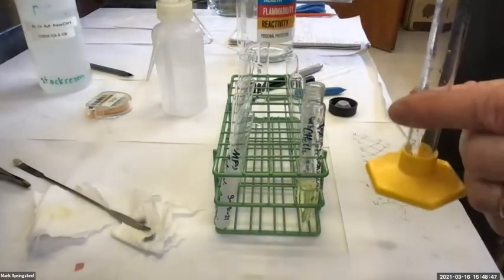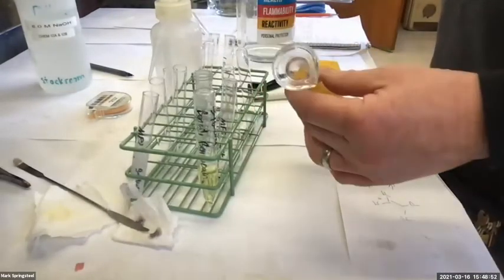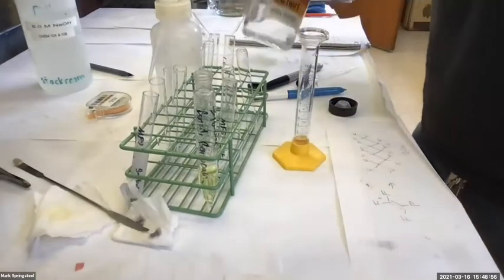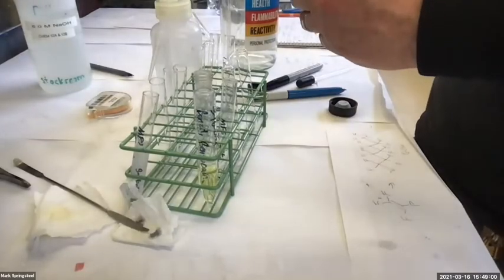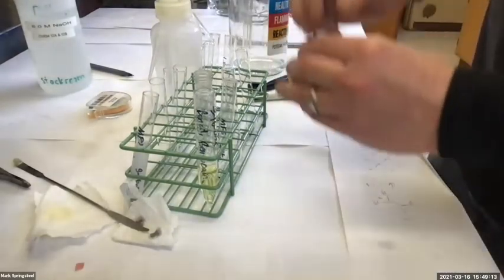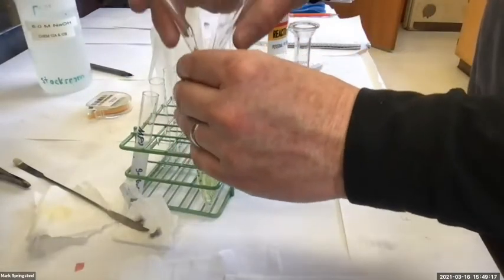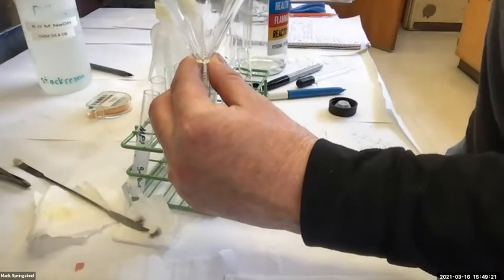This had a little bit of 1 molar sodium hydroxide from, no, did it have sodium hydroxide? No, just 1 molar HCl is all this has had. So this is good to use again. Oh no, it had methylene chloride in it last, all good. Okay, looking good. A little more than 4 milliliters, close enough. I'll leave a gap so the air can escape as I add it.